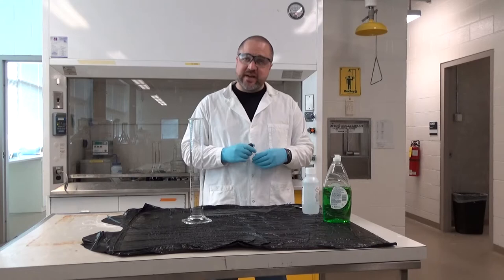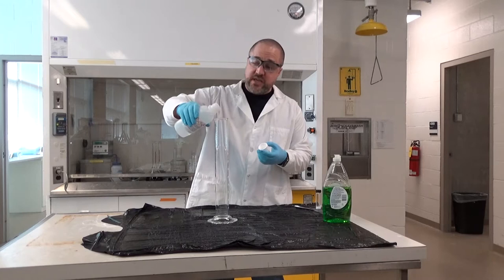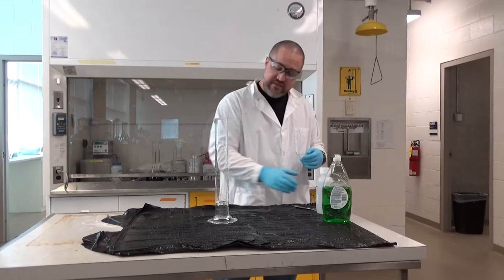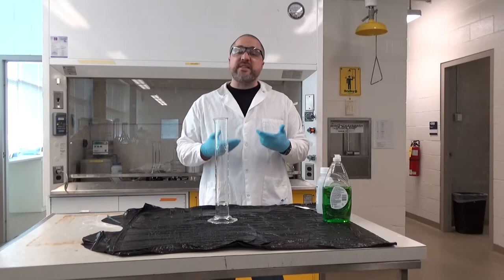I have here some hydrogen peroxide — the same product you have at home in your medicine cabinet, used to disinfect a wound when you scrape your knee. What you have at home is typically a 3% solution; what I have here is a 30% solution, which is ten times as strong — that's why I'm wearing gloves. The chemical formula for hydrogen peroxide is H2O2. If I leave it in this graduated cylinder and wait long enough, the peroxide will degrade on its own into water (H2O) and oxygen (O2), but this is a very slow reaction.